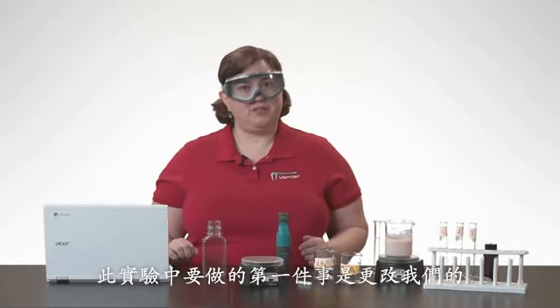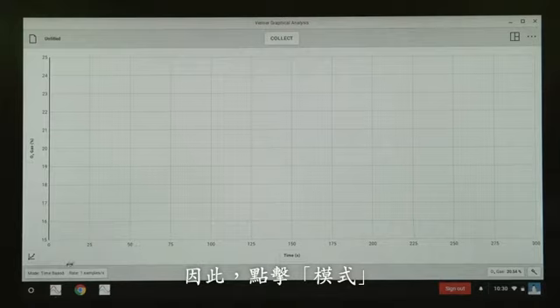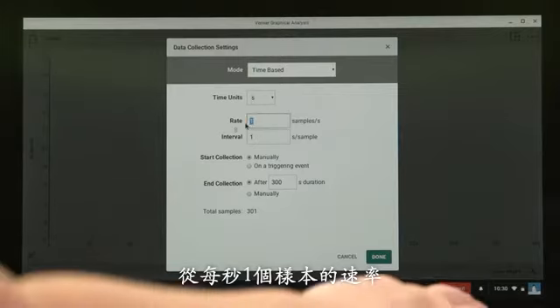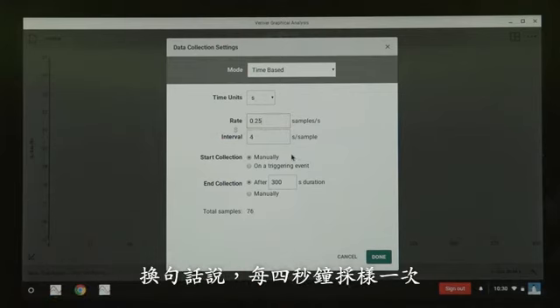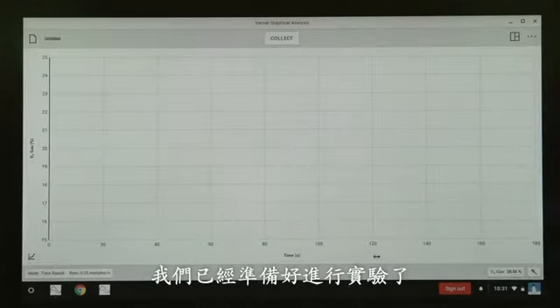The first thing we want to do in this experiment is actually change our data collection rate and duration. So I'm going to click or tap on Mode. And we're going to change our rate from 1 sample per second to 0.25 samples per second. In other words, we are going to take 1 sample every 4 seconds. Then we're going to change our duration from 300 seconds to 180 seconds. Once you've done that, you can then click or tap on Done, and we are ready to proceed with the experiment.